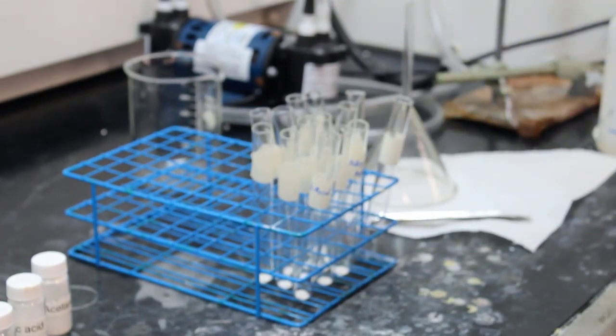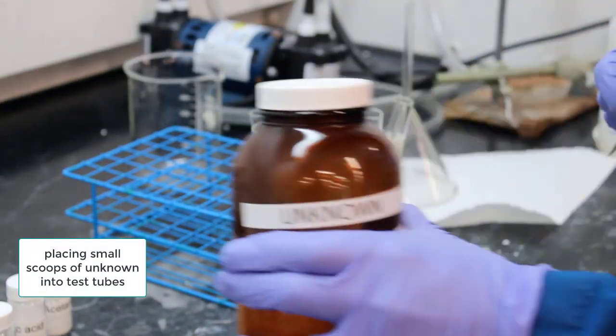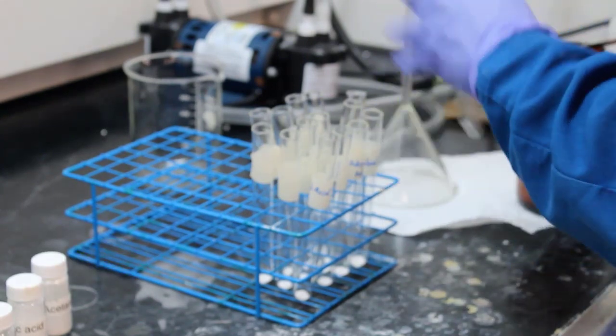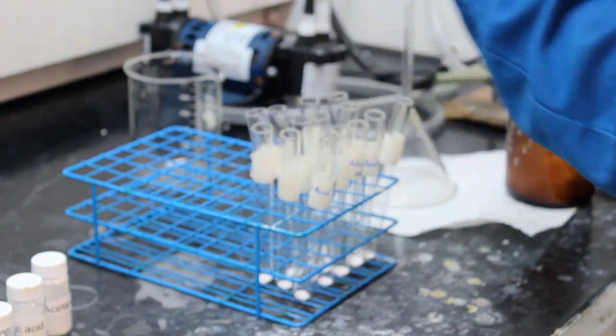Alright, making a note on the glassware. Aside from not getting confused, it's good to write notes on the glassware because it goes against safety code to not write on glassware what's in it.